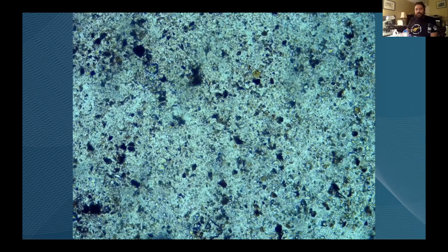So here's a great little photo. This is something that we'd actually call dirt. This is an image of a soil microscopy slide, actually from Greenpoint in Brooklyn, New York. This is right along the Gowanus Canal. It's the estuary that basically shoots off the East River that separates Queens and Brooklyn. So this is a super fun site. There are 6 to 7 layers of black mayonnaise at the bottom from all these petroleum refineries. And we can very easily say that these soils have gone through an ecological disturbance, an anthropogenic ecological disturbance.